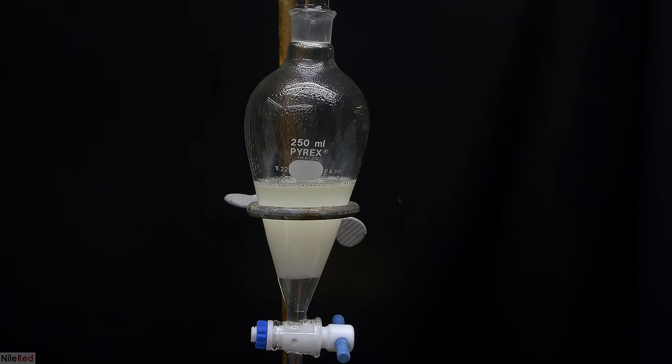A small amount of isopropanol was used to wash the crystallizing dish as well as the funnel. I then set things up for a fractional distillation, and to show the whole apparatus, I used a very skillful moving shot. A heating mantle is placed under the flask, and we turn it on to get the distillation started. At first, our reaction mixture is going to be opaque with aluminum isopropoxide floating around, but as we heat things up, everything should eventually dissolve. It also takes on a yellow color, but I'm not exactly sure why it does this. The column is insulated with some aluminum foil to keep it hot so the vapors can make it over.